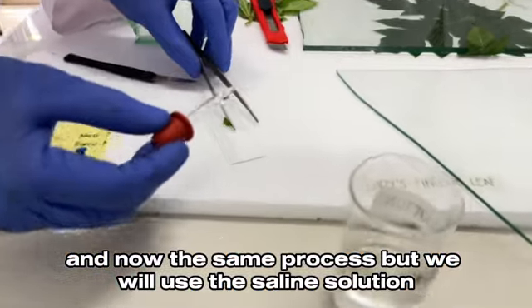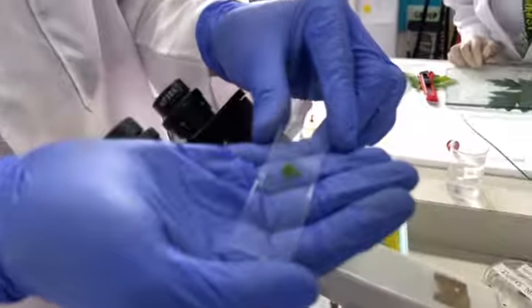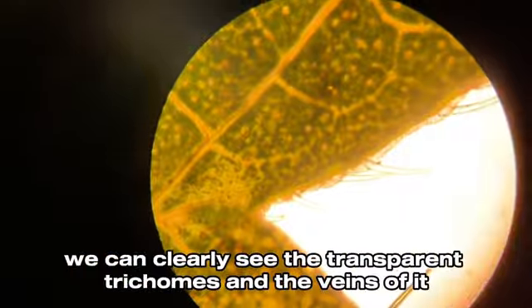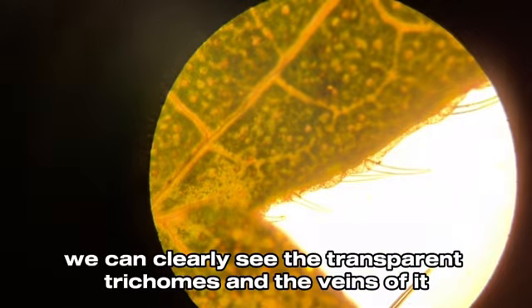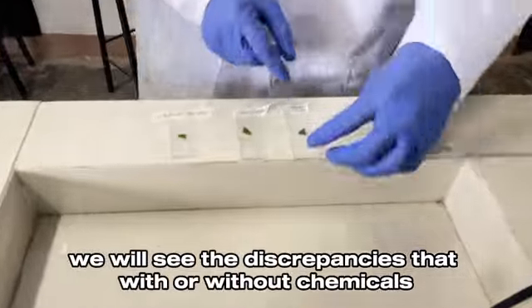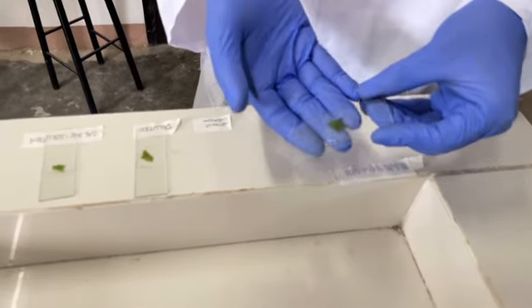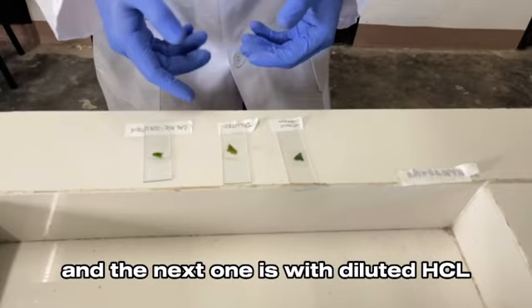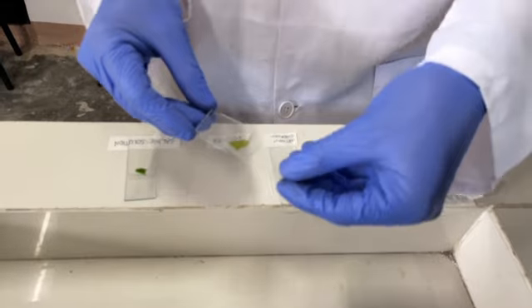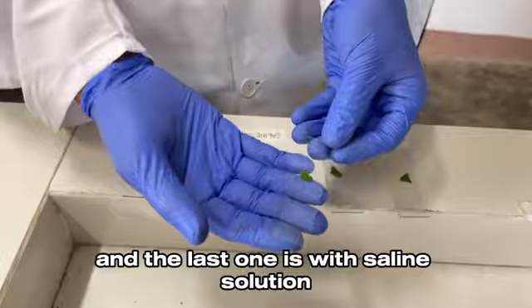And now, the same process, but we will use the saline solution. As we see in our compound microscope, we can clearly see the transparent trichomes and the veins of it. At this moment, we will see the discrepancies with or without chemicals. This one is without chemical, the next one is with diluted HCl, and the last one is with saline solution.